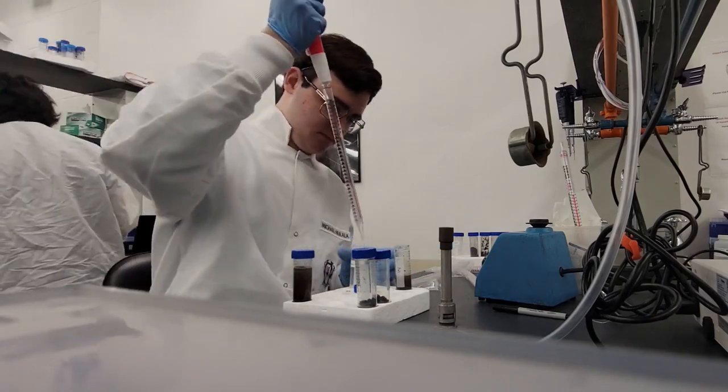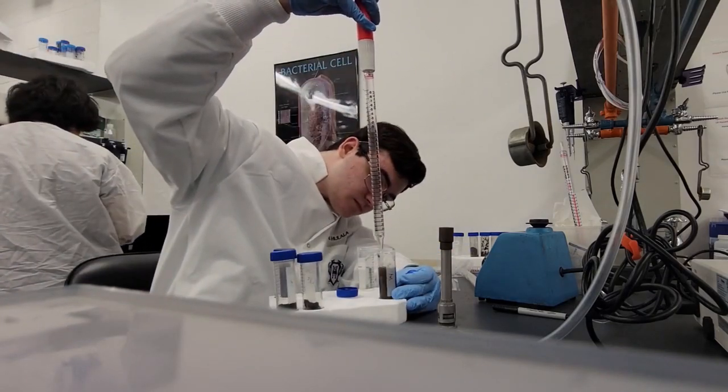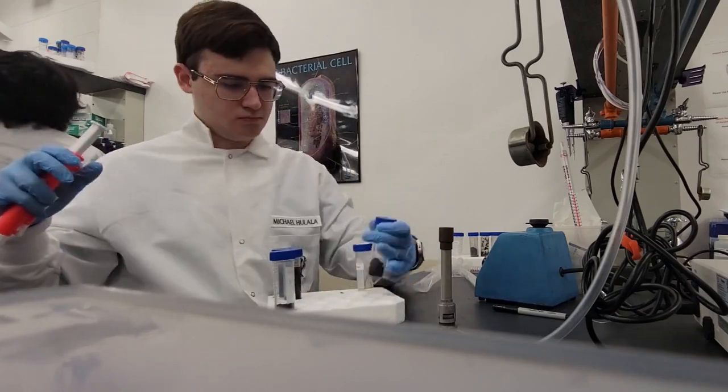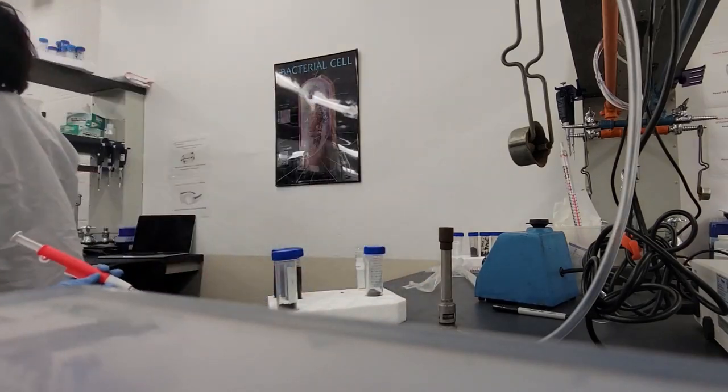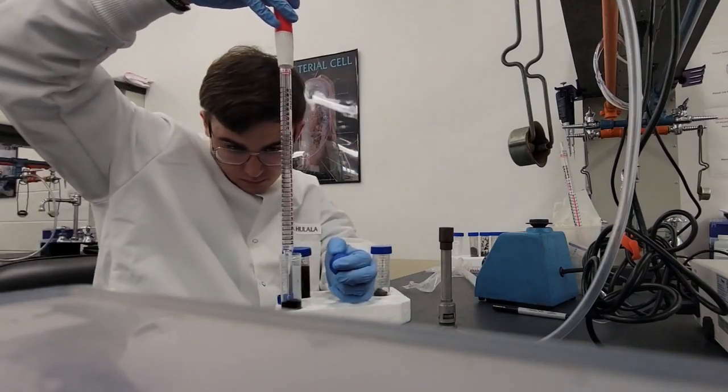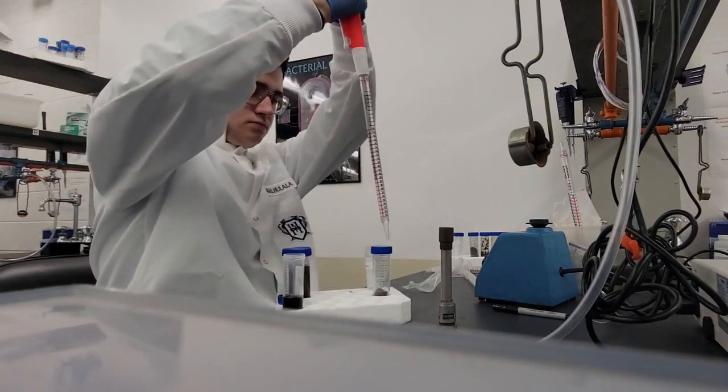We're praying that we have bacteria and a phage inside of the soil sample, so we're going to brew it up and make sure that there's plenty of it so we can work with it more. Because sure, maybe you have one or two, but that's not enough to really get a positive result later on.